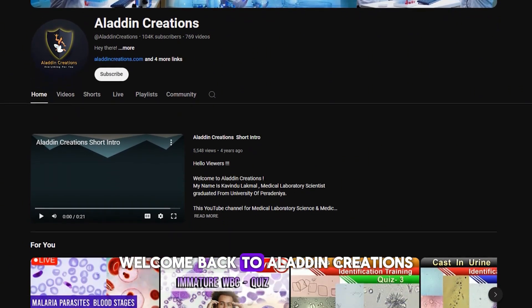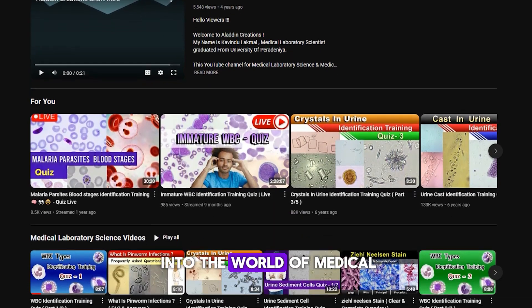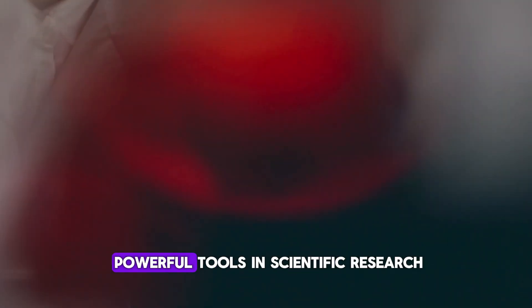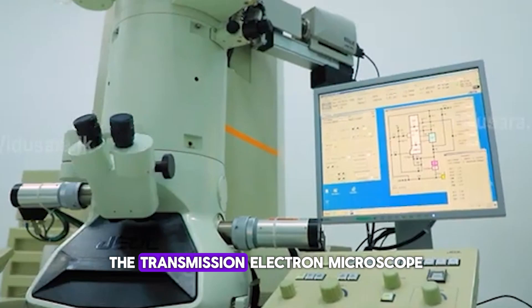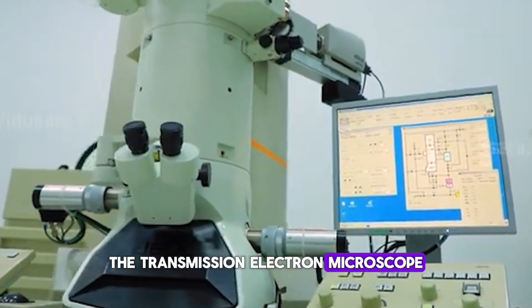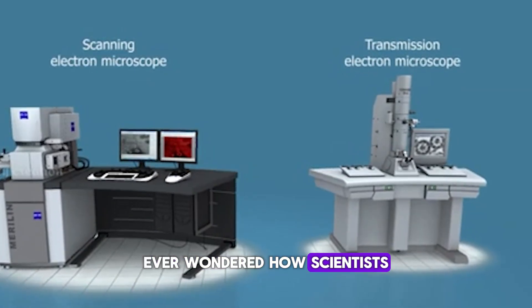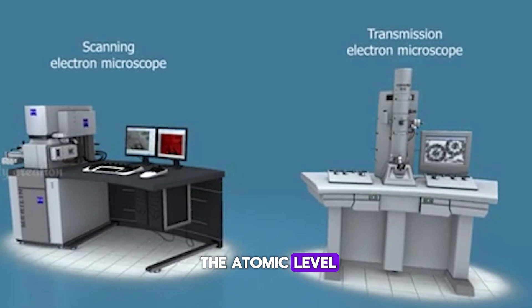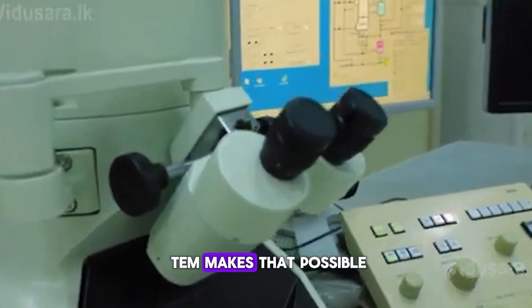Welcome back to Aladdin Creations, where we dive deep into the world of medical laboratory science. In today's video, we're exploring one of the most powerful tools in scientific research: the Transmission Electron Microscope, or TEM. Ever wondered how scientists can see inside cells or view materials at the atomic level? Let's find out how TEM makes that possible.